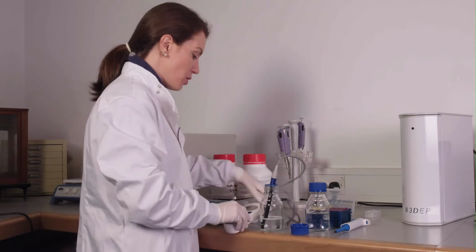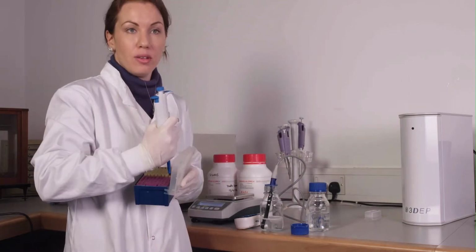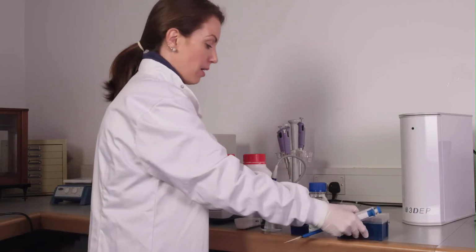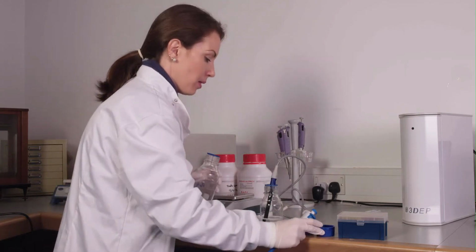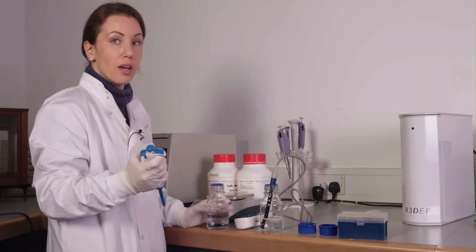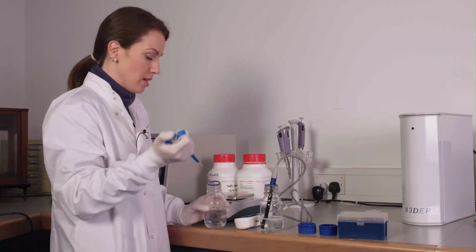And what you'll use to adjust the conductivity, typically we use PBS. Now this is PBS without calcium or magnesium. And you'll add little bits at a time of PBS to adjust the conductivity. Depending on your total volume, so in this case we're using 100 milliliters, will depend on how much PBS you add at a time. So in this case we're adding 75 microliters at a time.